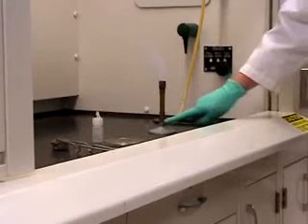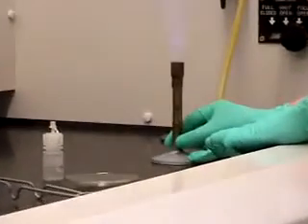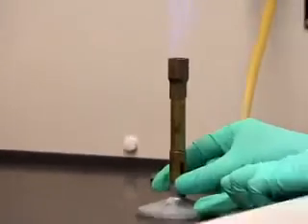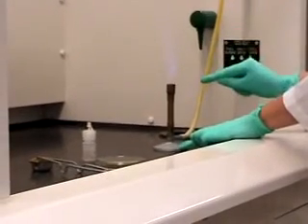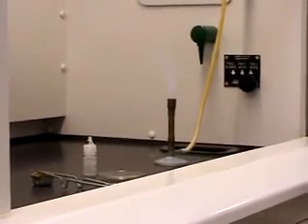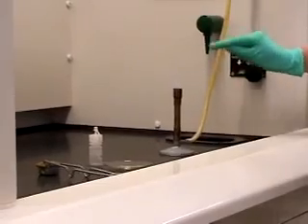Right at the bottom of the barrel, there's an area in which you can rotate to change the amount of oxygen in the flame. And when you can hear a little hiss on the flame, that's the time when you've optimized the flame. And typically you can see an inner cone and an outer cone on the flame. If you look carefully, you can see an inner cone right here.